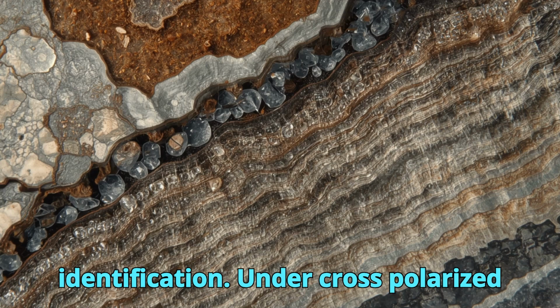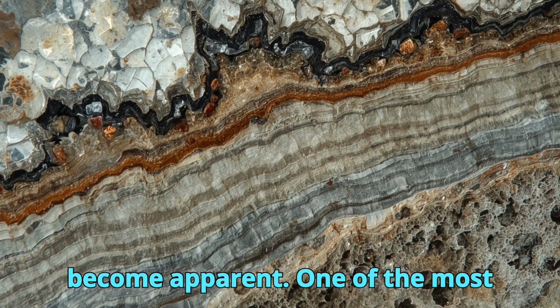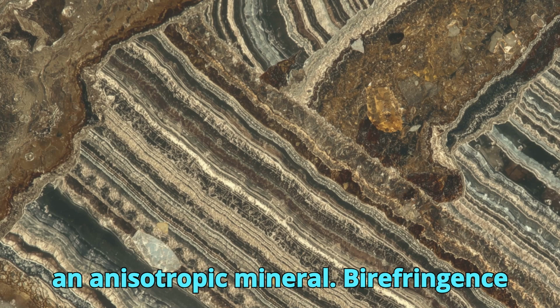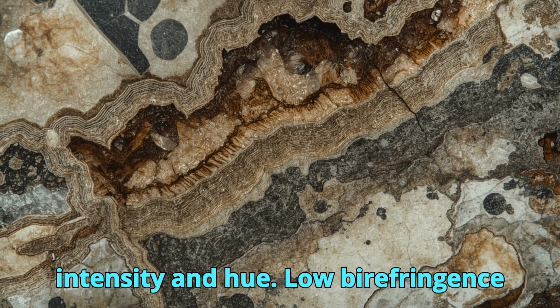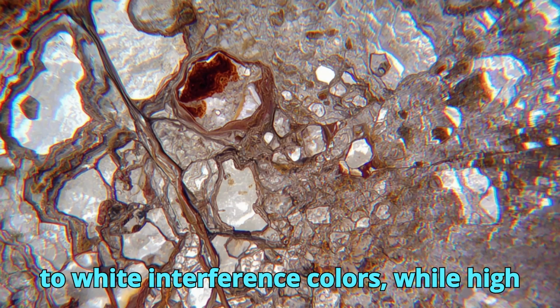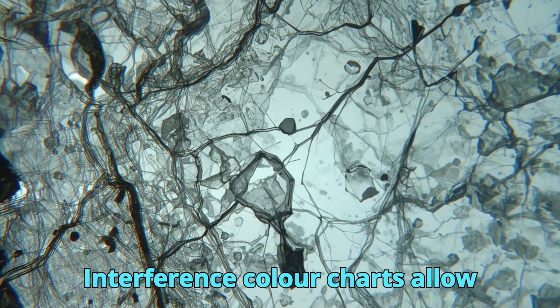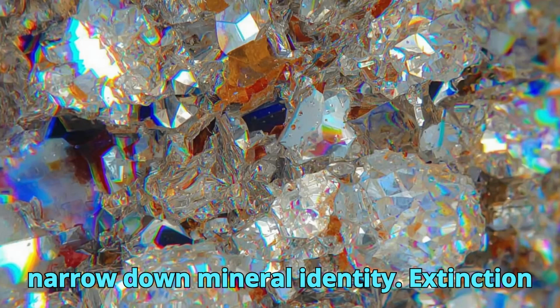Under cross-polarized light, XPL, additional optical properties become apparent. One of the most important is birefringence, the difference in refractive indices within an anisotropic mineral. Birefringence produces interference colors that vary in intensity and hue. Low birefringence minerals such as quartz display gray to white interference colors, while high birefringence minerals like calcite exhibit bright, high-order colors. Interference color charts allow geologists to estimate birefringence and narrow down mineral identity.